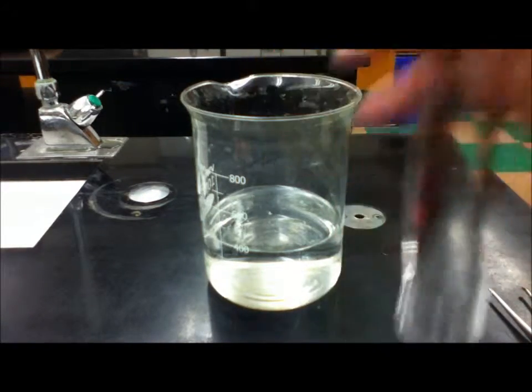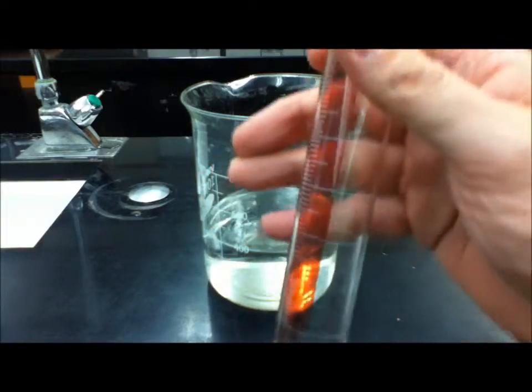So that when we tip it upside down it's going to stay there. So we shake it up and down here and it's not moving, so we're okay.